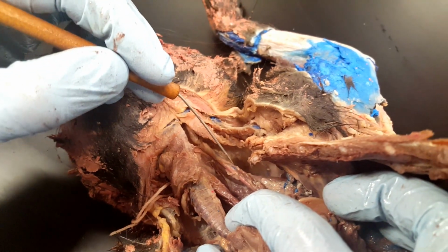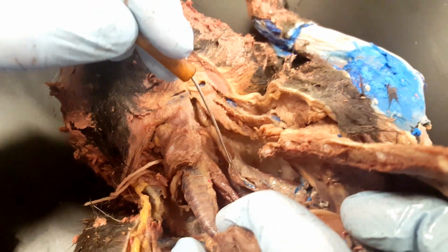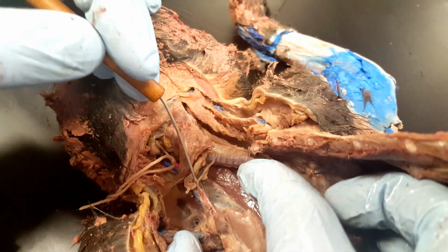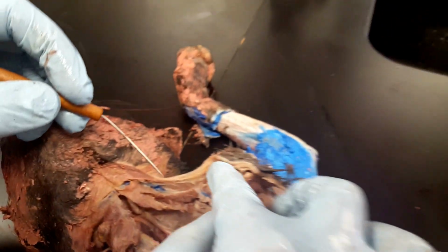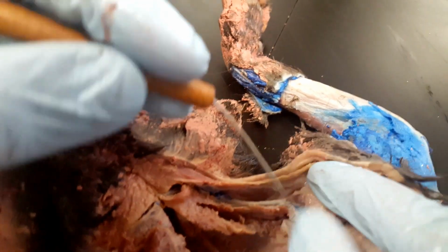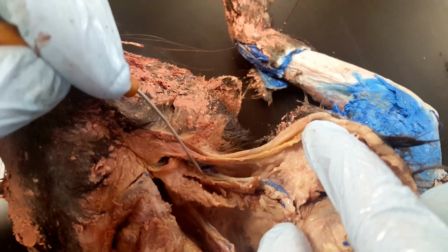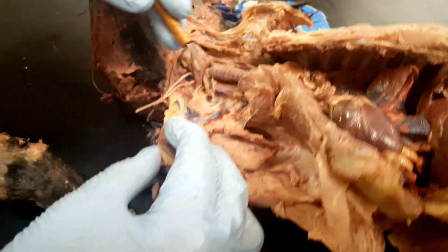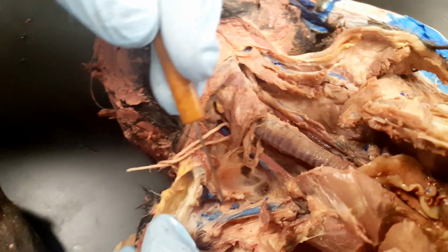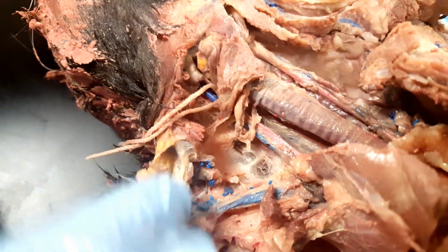And we also have next to them the internal jugulars in blue. So there's one of them in blue, and then here's the other one. And then on the outside of that we have the external jugulars. This one's been cut a little bit, but you can follow this blue structure up. And there's some more of it. And then over here we have another one, external jugular in blue. It's been cut there, but then it continues here. You can see that part of it.